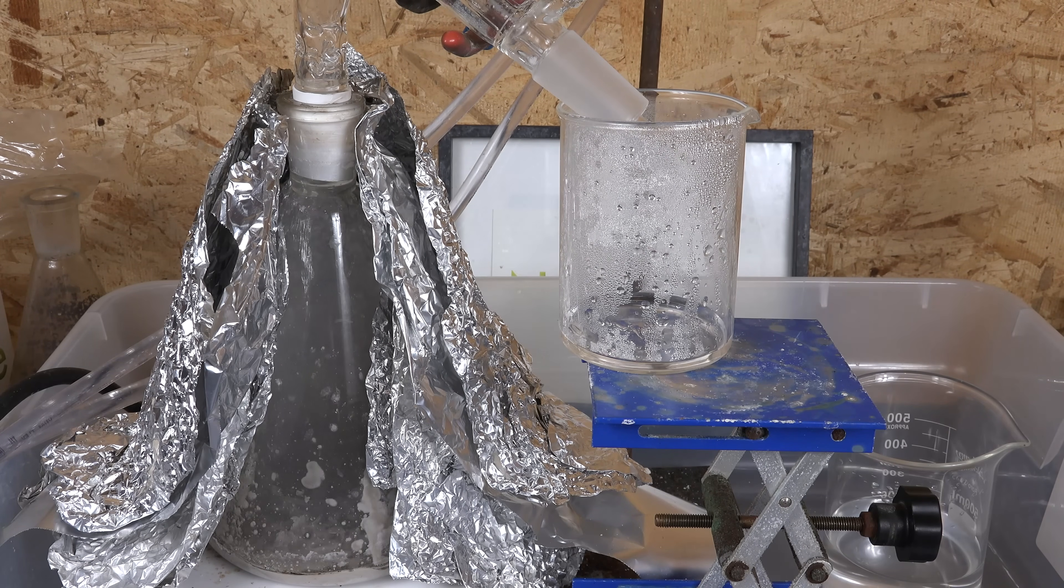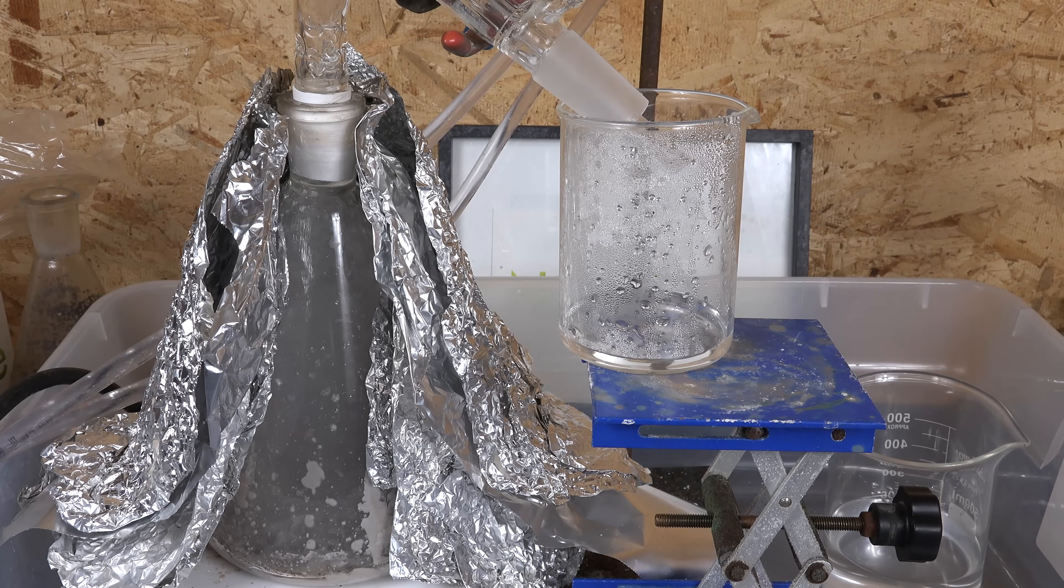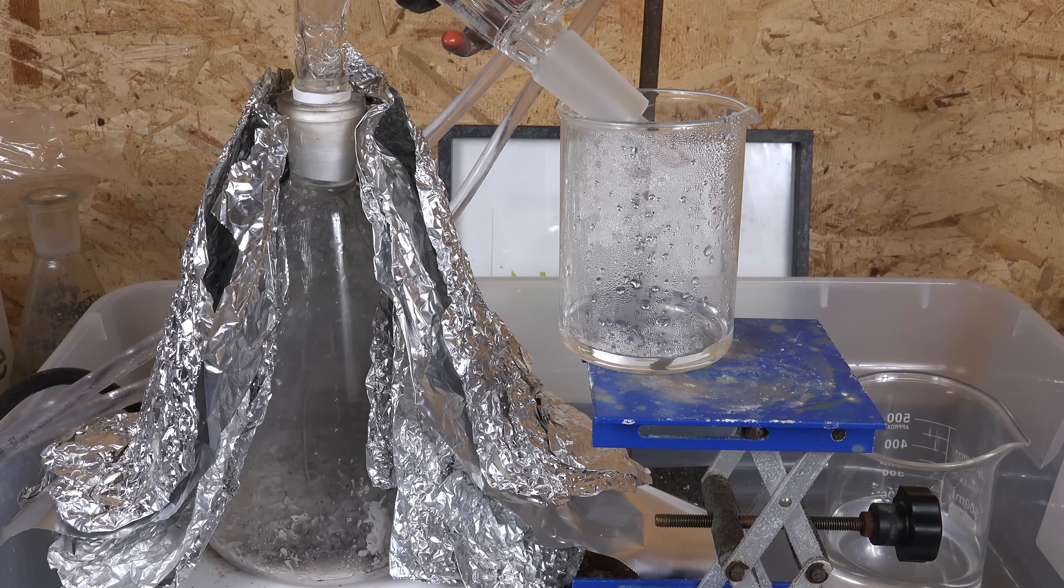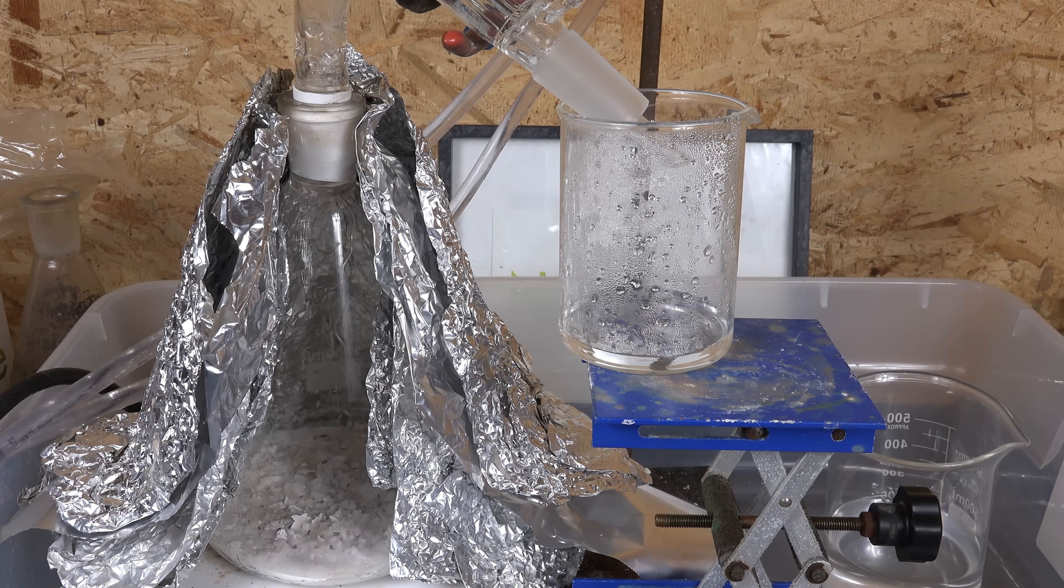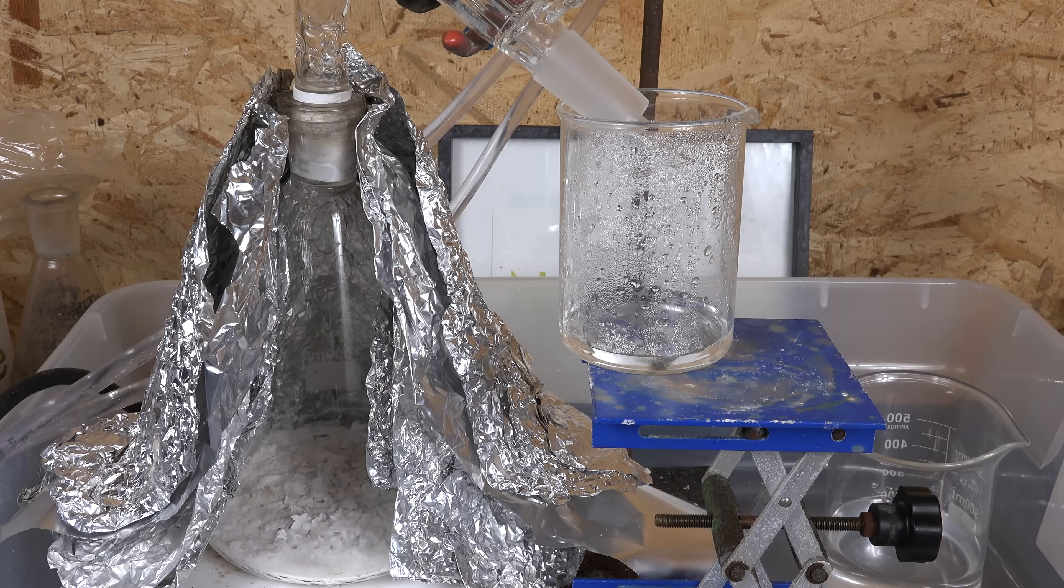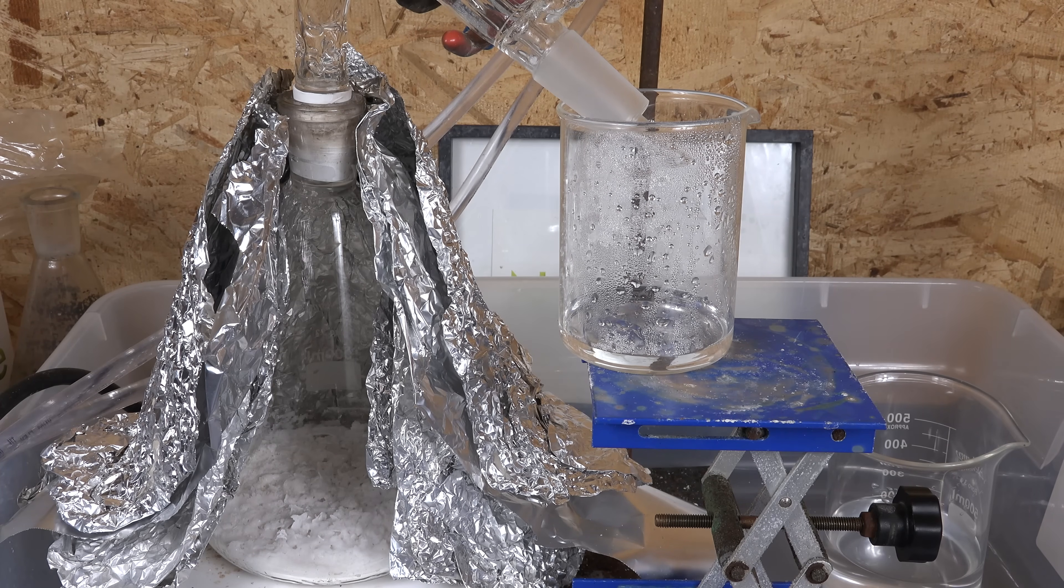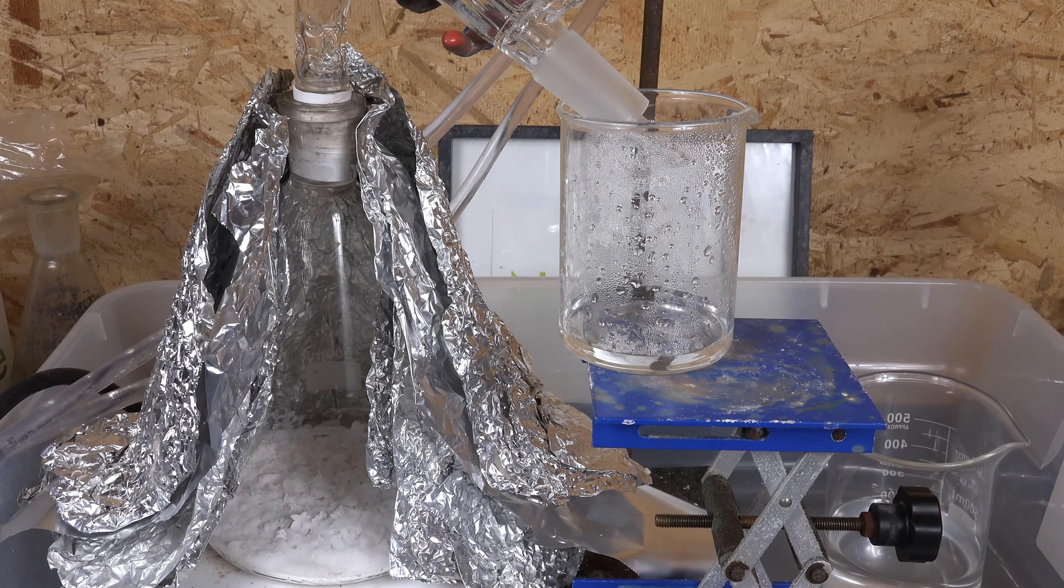Before I go, I'm also going to look at a similar process of using magnesium sulfate rather than iron sulfate. And I'll tell you up front that it failed and only gave 2% yield so feel free to stop the video now or watch me analyze why it failed.